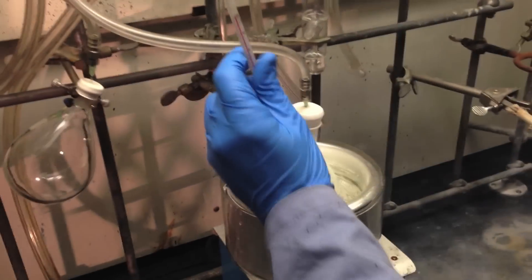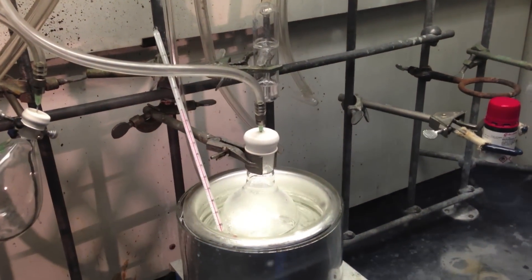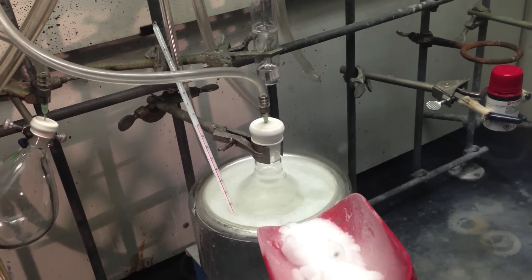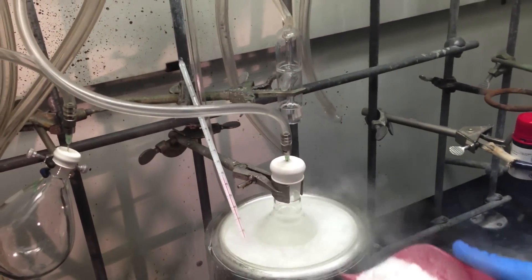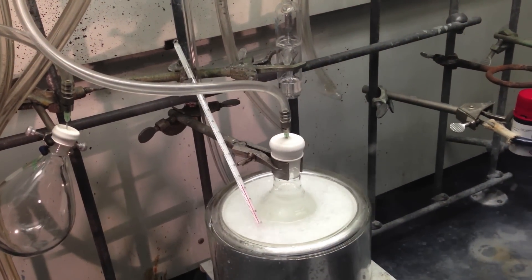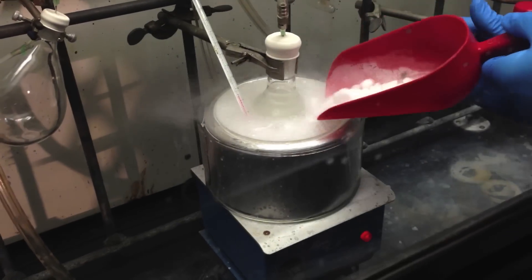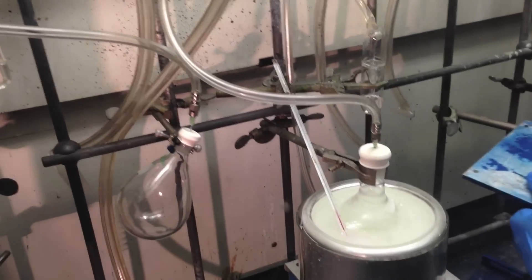This reaction needs to be conducted at negative 78 degrees Celsius, so I'm going to put my thermometer in. I can see it's not cold enough yet, so I will add some dry ice. Now our reaction is chilled to negative 78, and it's time to add the methyl-lithium.